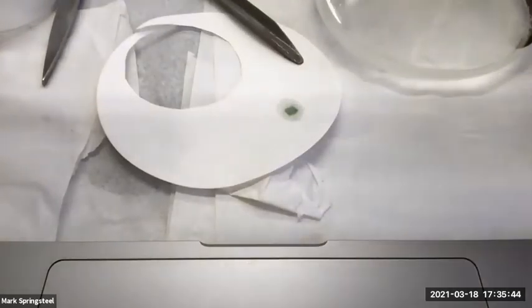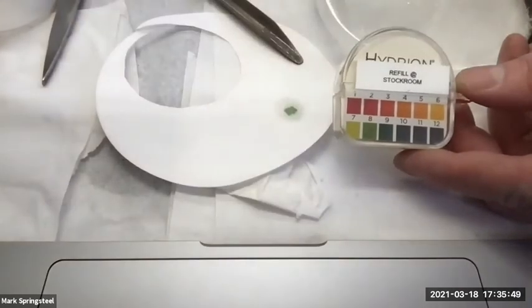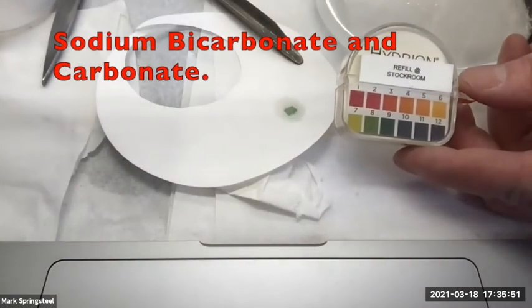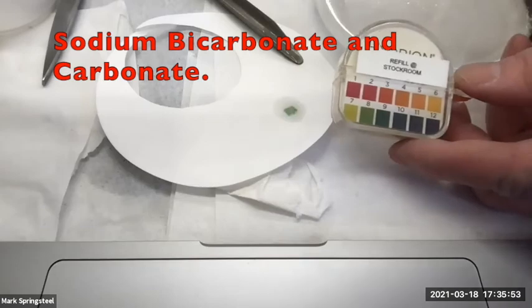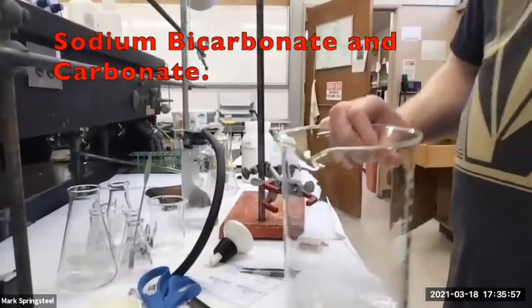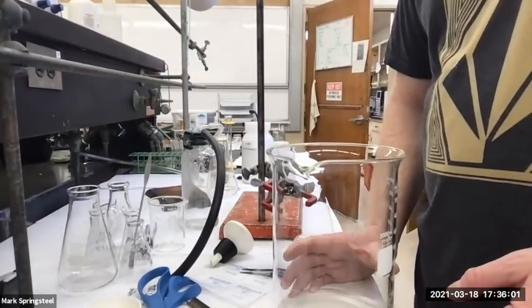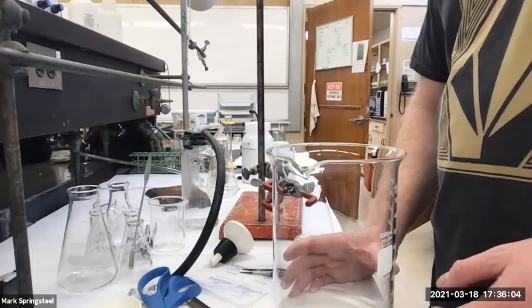Oh yeah, it looks good. It's green. So green, what pH is that? We're at like pH 8. And that actually makes sense. A solution of sodium bicarb is about pH 8. So that's what we want. So now I can put this in the waste container. Yeah, we're doing pretty good here. Just gonna wait till tomorrow.